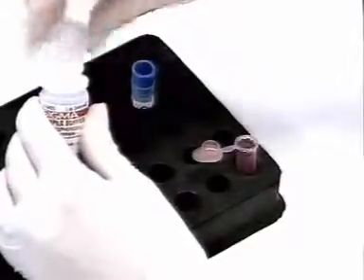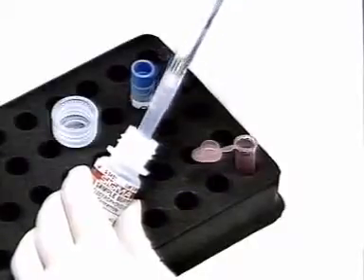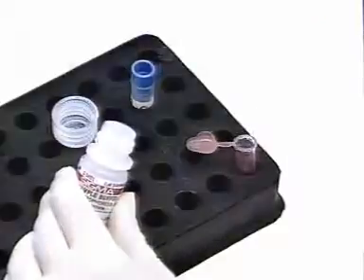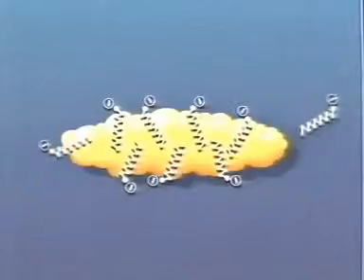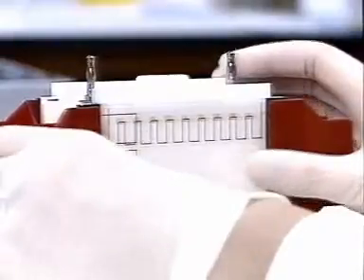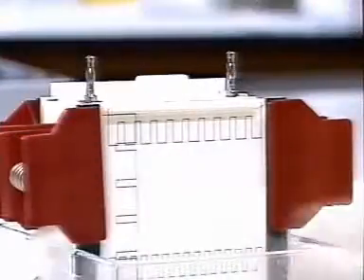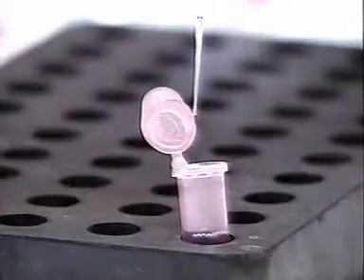The colourless proteins are treated with a mixture containing glycerol, bromophenol blue, and sodium dodecyl sulfate. The bromophenol blue colours the mixture. The protein molecules absorb the dodecyl sulfate anions and become negatively charged. The plastic sheet marks the position of the wells in the colourless gel. The protein mixture with the added glycerol sinks in the wells left in the solid gel.